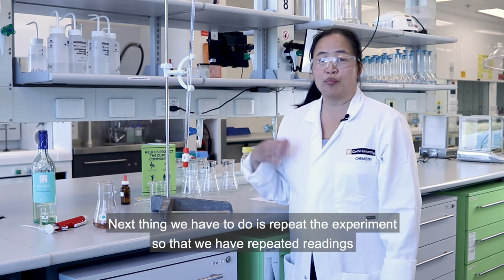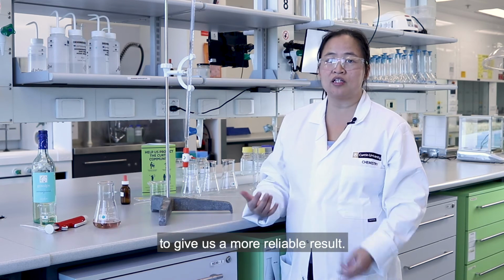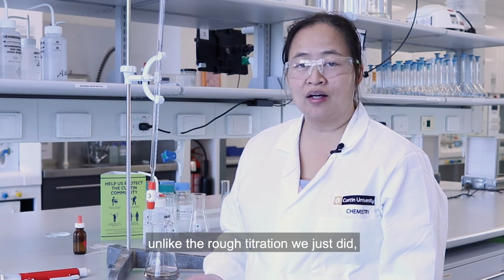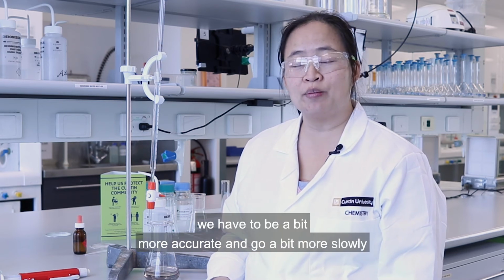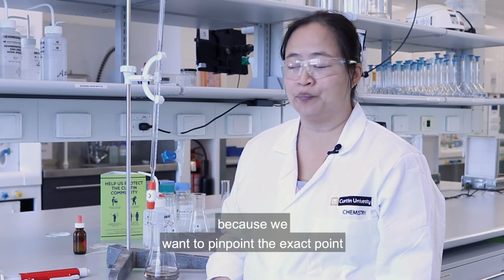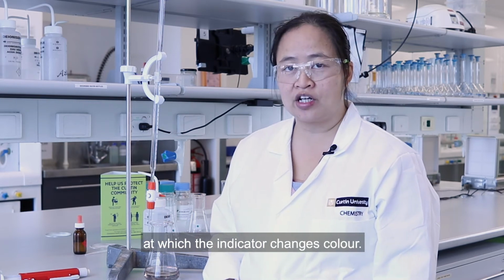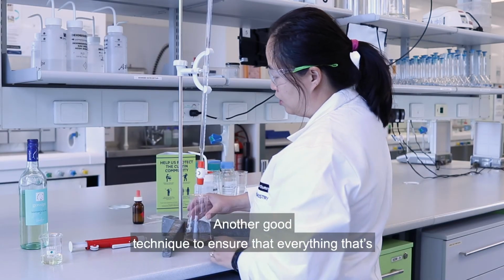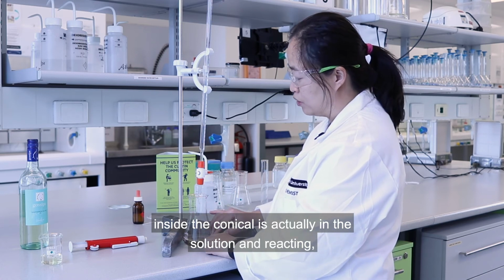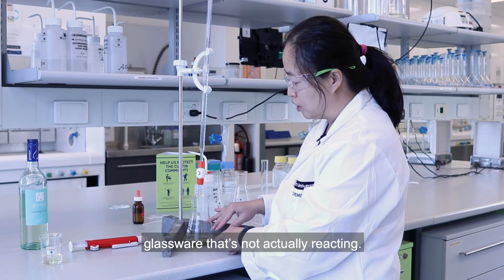Next thing we have to do is repeat the experiment so that we have repeated readings to give us a more reliable result. So when we're repeating our titration, unlike the rough titration we just did, we have to be a bit more accurate and go a bit more slowly when we're almost at the end point, because we want to pinpoint the exact point at which the indicator changes colour. Another good technique is to ensure that everything that's inside the conical is actually in the solution and reacting, because you may have some droplets on the glassware that's not actually reacting.